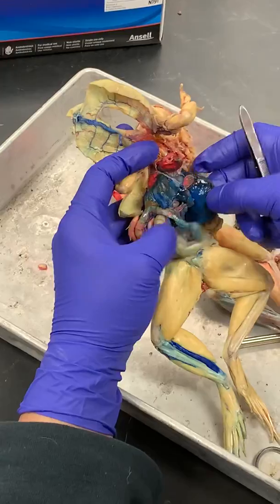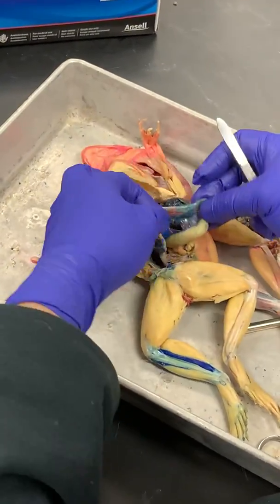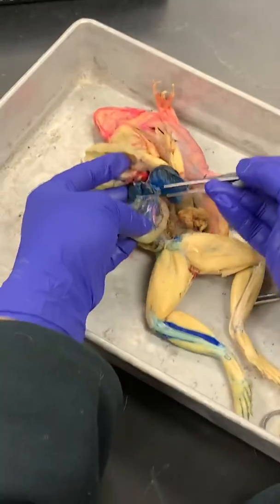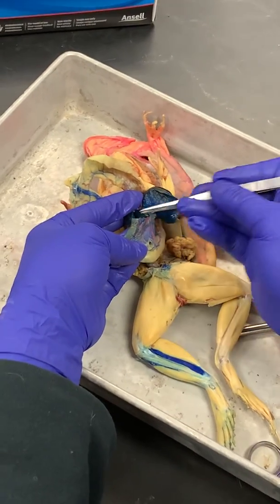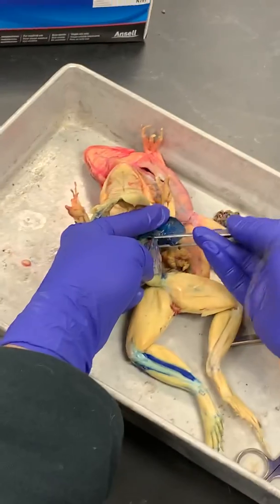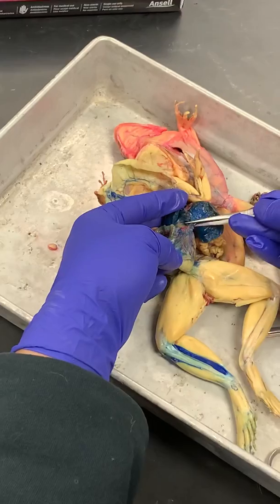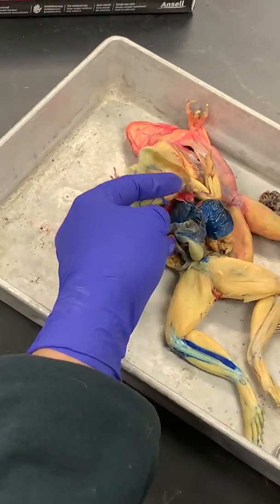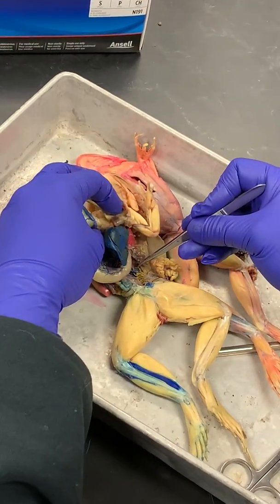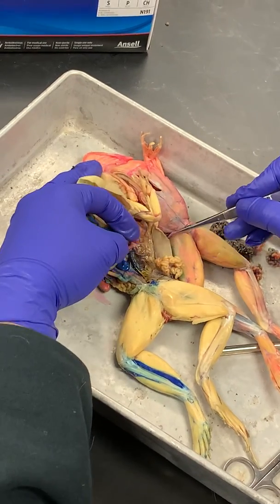And then finally, if we look in the stomach here, in our greater omentum, we can pick up this huge tributary vein. It's got all these little things coming from the stomach and then going up into the liver, posterior to the gallbladder. This is the hepatic portal vein. So three veins: ventral abdominal, post cava, and hepatic portal. And just remember that the post cava has those renal veins on it.